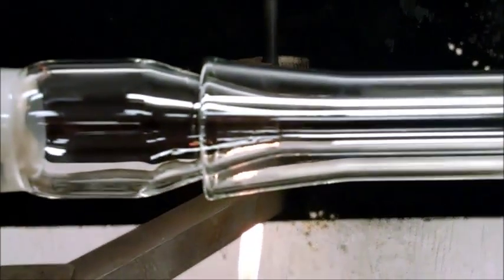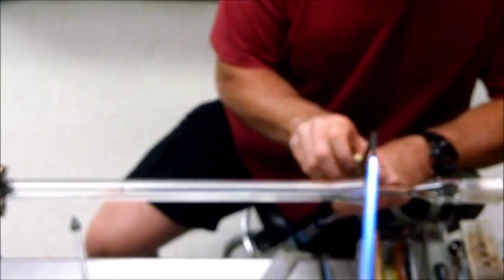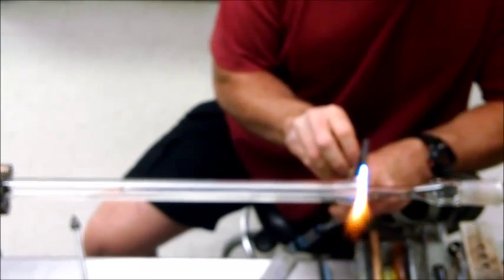So see, here's where I'm going to do my seal, and right here — look inside here, see if I can get this to come up here — see the little hole there? I've got a hole next to the flange. Okay, so the first thing I do — timing is a bit of an issue here — so what I do is I preheat this lip, because I want this to get soft before the other part.